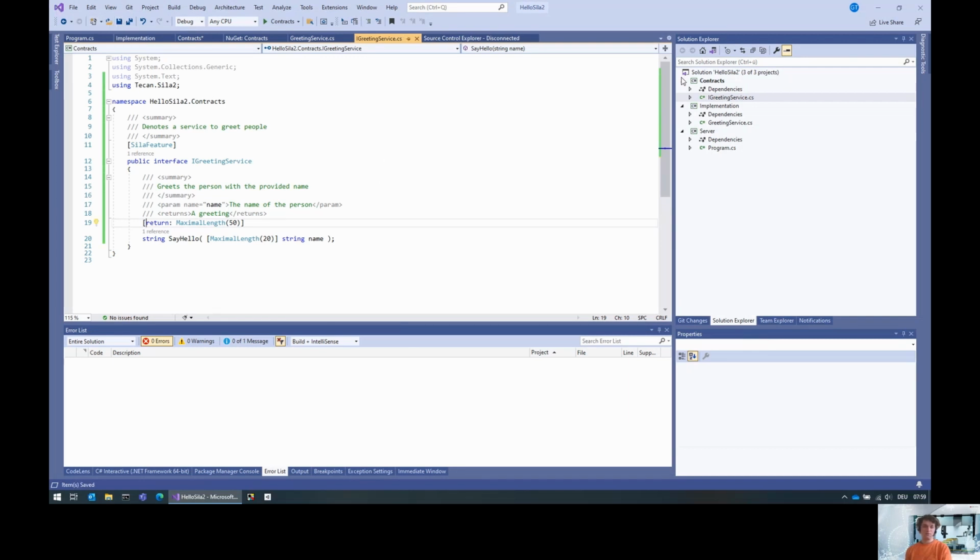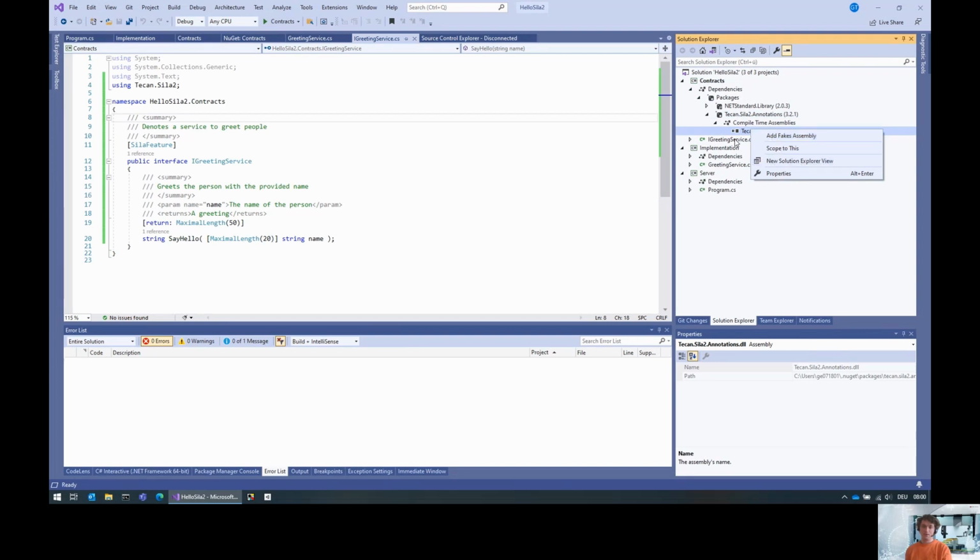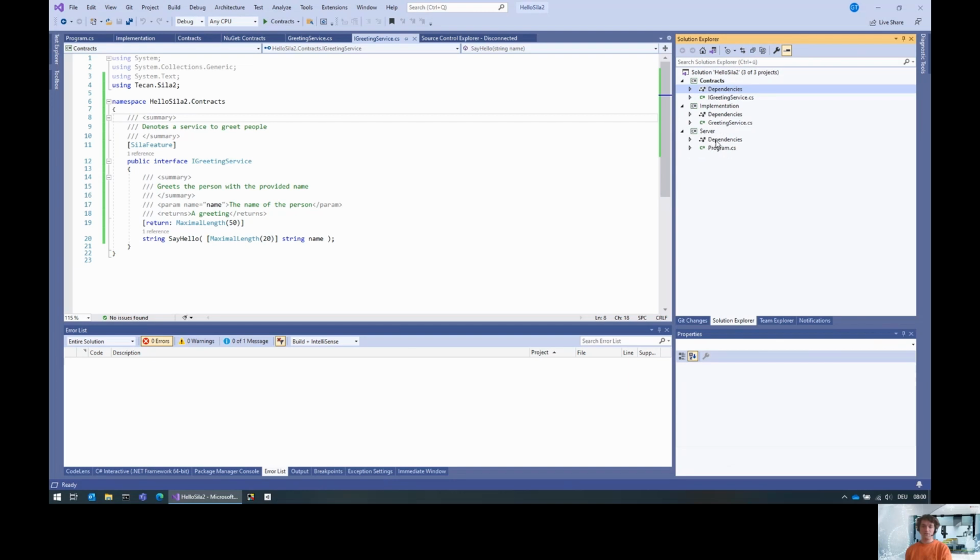Next thing, very important, we need to compile the contracts project. The reason for that is that the code generator that is included in the SiLA 2 SDK only works on compiled assemblies. For that, we need a compiled assembly, and we do that by compiling the assembly. Next thing is we actually need the actual SDK. The annotations that I've given you earlier only give this SiLA 2.annotations DLL, which is an assembly that only consists of attributes, so there's no code in there. It is very lightweight and not really much of a problem to include into a contracts assembly that otherwise only consists of interfaces and data transfer objects.